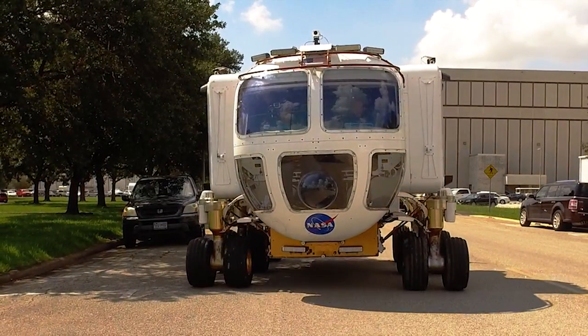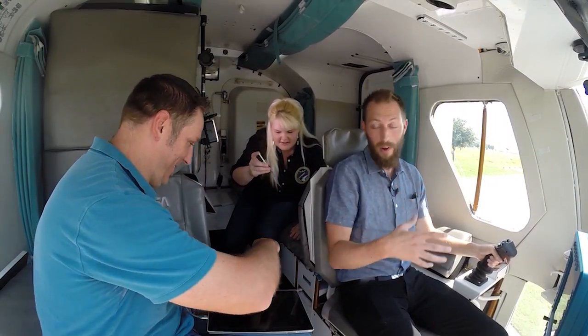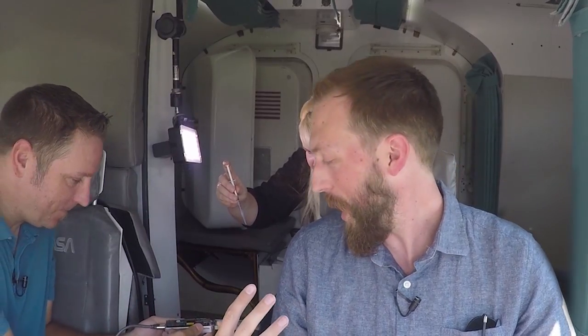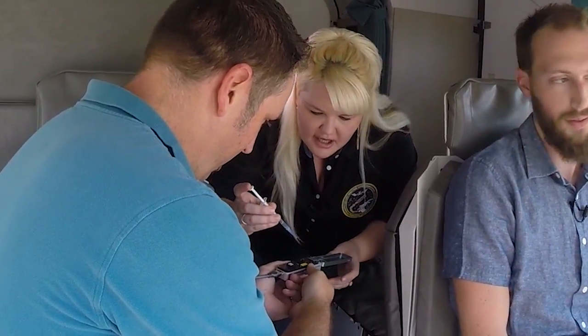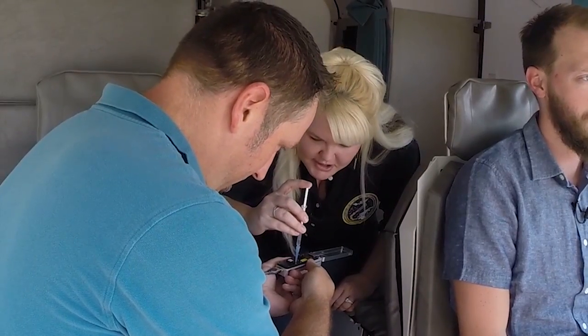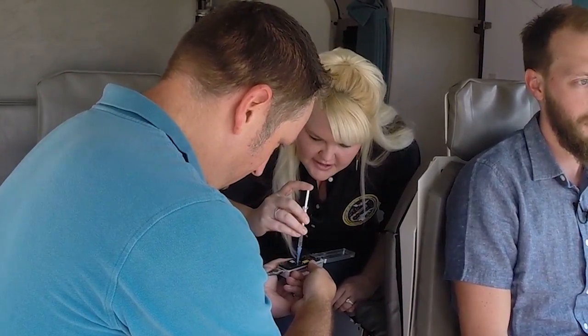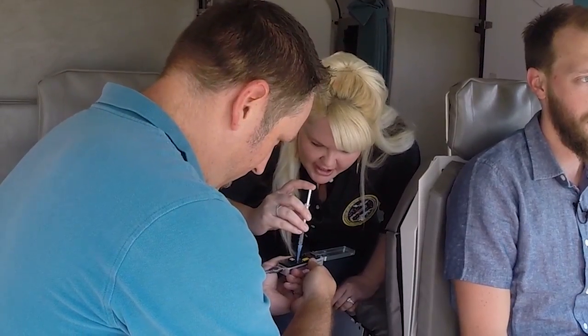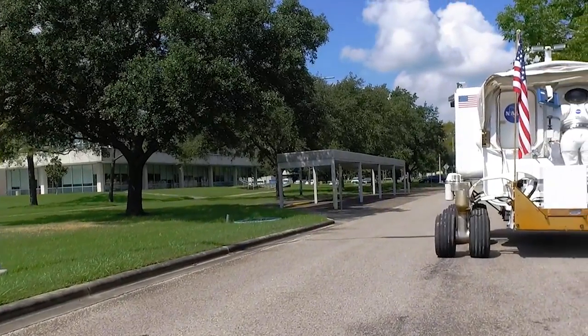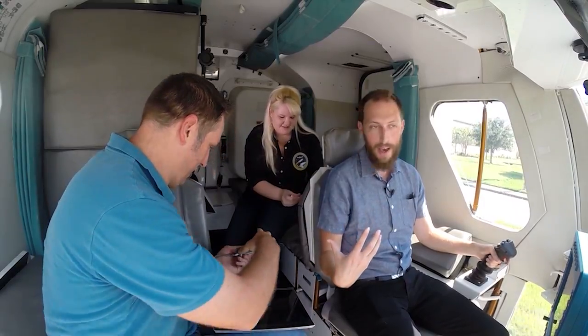Hey Aaron, you want to sequence some DNA in a rover? So you can do it right here — that's it. Yeah, this is it. It's that small. That's insane. So what's actually happening? I have a sample here that contains DNA from a mouse, a virus, and a bacteria — the same samples that are on the ISS that have been sequenced — and I'm injecting them into this miniature DNA sequencer. We are actually going to start collecting the sequences while we're roving around. This has never been done in a rover before. I think it's safe to say, never been done in a rover. Breaking new ground here.